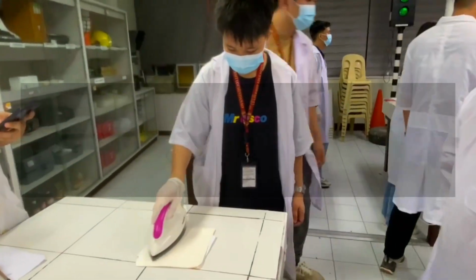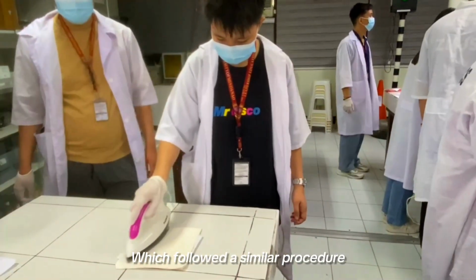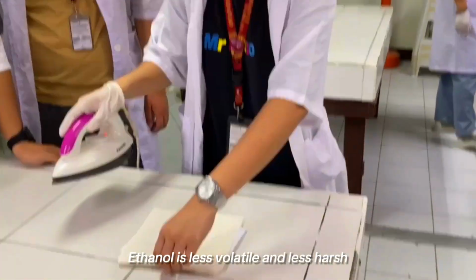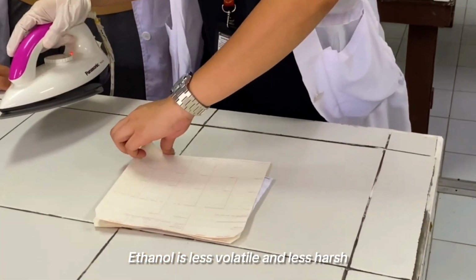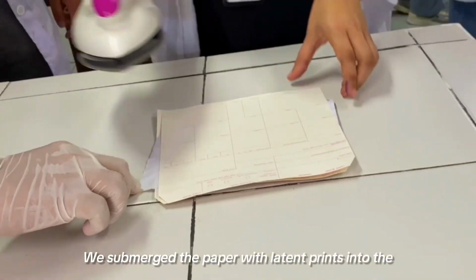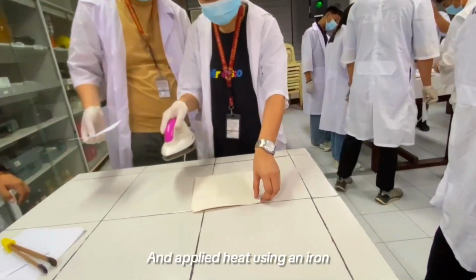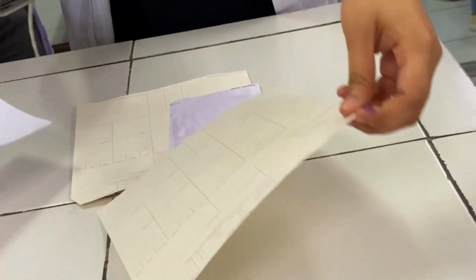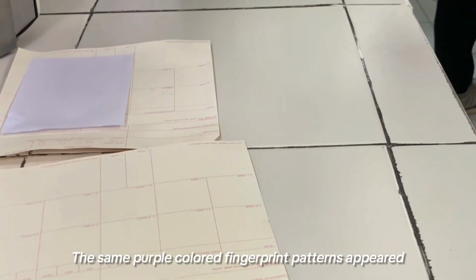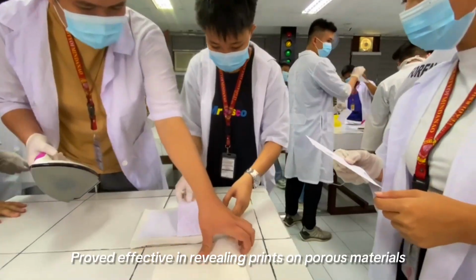Ethanol-Ninhydrin Method. Next, we tried the Ethanol-Ninhydrin Method, which followed a similar procedure, but used ethanol as the solvent instead of acetone. Ethanol is less volatile and less harsh, making it suitable for delicate or older documents. We submerged the paper with latent prints into the solution, allowed it to dry for a while, and applied heat using an iron. After a few minutes, the same purple-colored fingerprint patterns appeared. Both ninhydrin methods proved effective in revealing prints on porous materials.